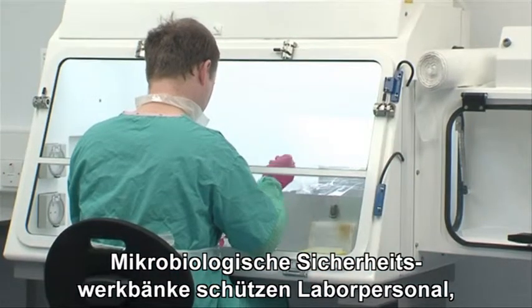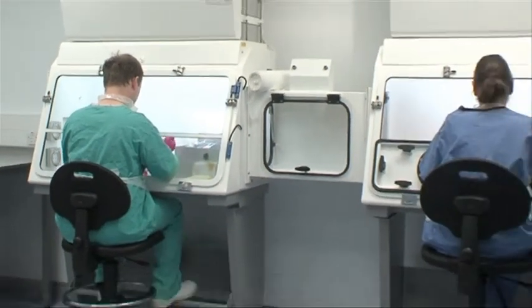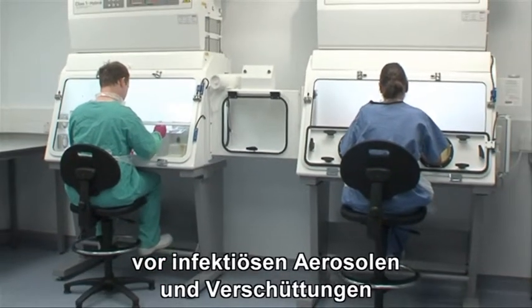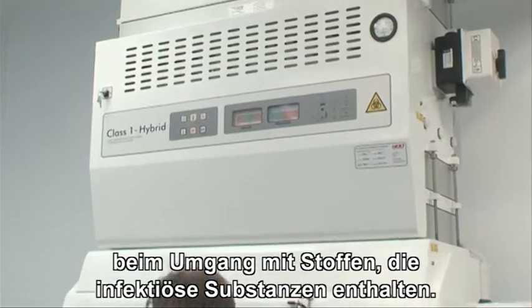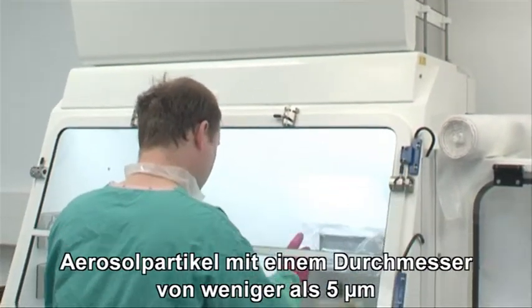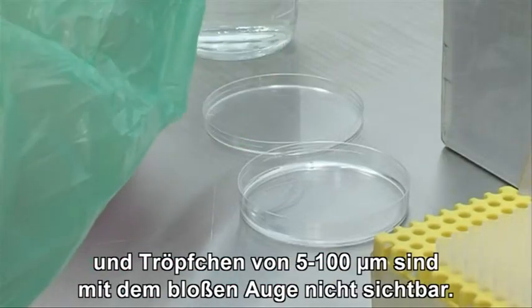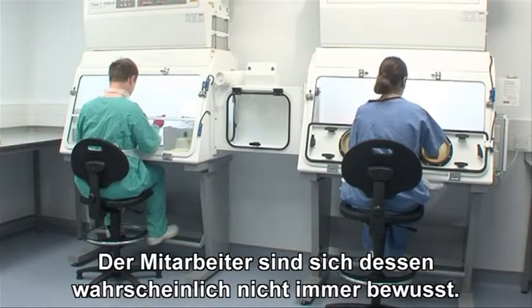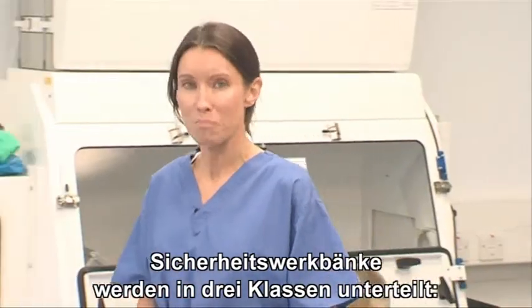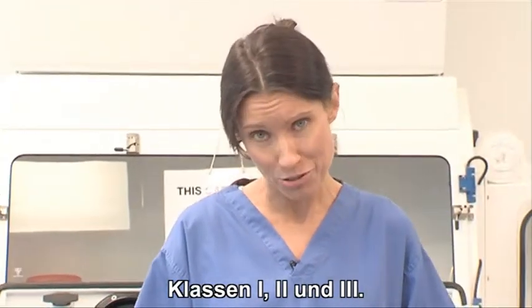Microbiological safety cabinets are designed to protect the operator, the lab environment and work materials from exposure to infectious aerosols and splashes that may be generated when working with materials that contain infectious agents. Aerosol particles of less than 5 micrometers in diameter and small droplets of 5 to 100 micrometers are not visible to the naked eye, so the operator is unlikely to be aware of them. There are 3 types of microbiological safety cabinets, known as Class 1, 2 and 3.